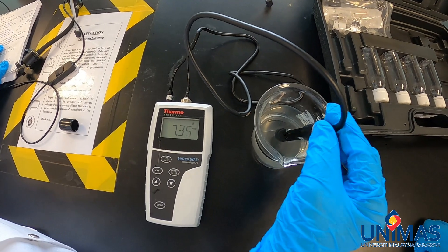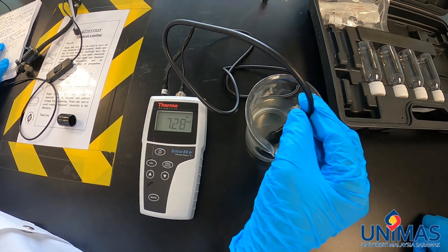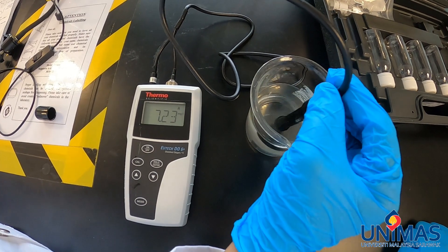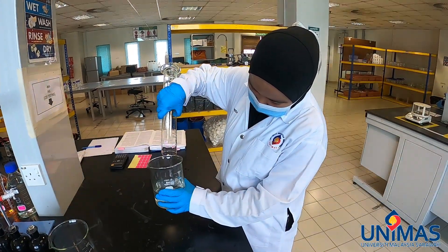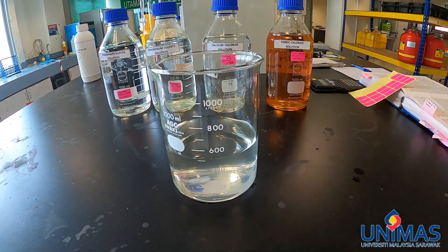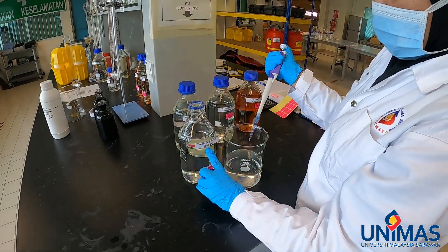Now we are measuring the DO level for the water sample to make sure that we have sufficient dissolved oxygen to start the BOD experiment without any dilution. The reading is fluctuating around 7.2 to 7.23. After preparing half a liter of water sample, we are not going to do any dilution because we expect the BOD to be less than 7 mg/L. We use a pipette to take 1 mL solution from each of the reagents.